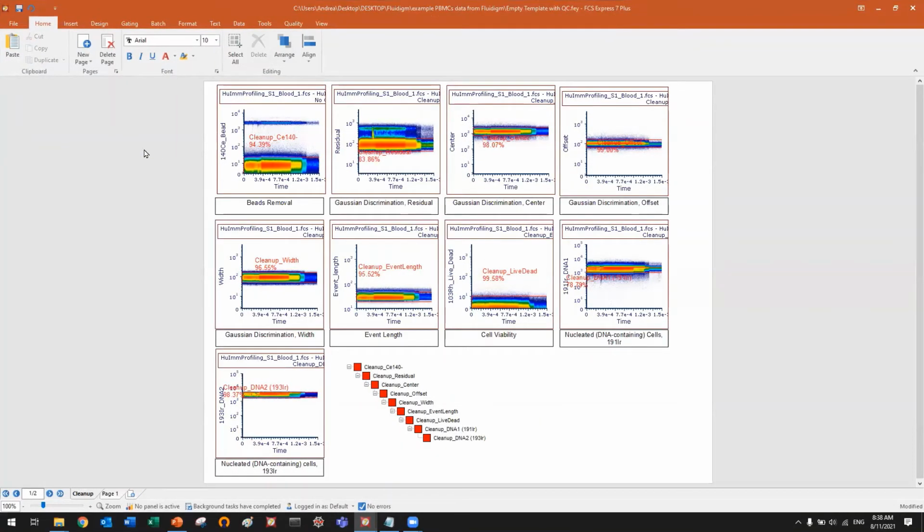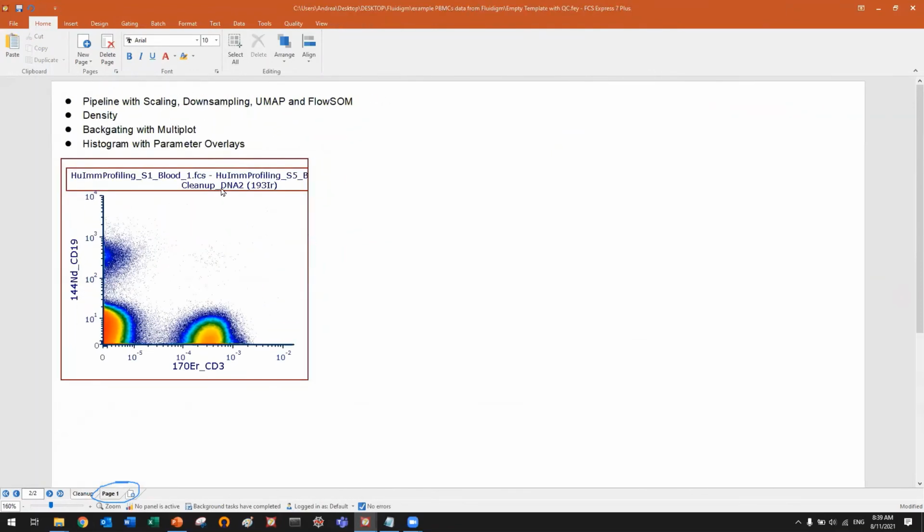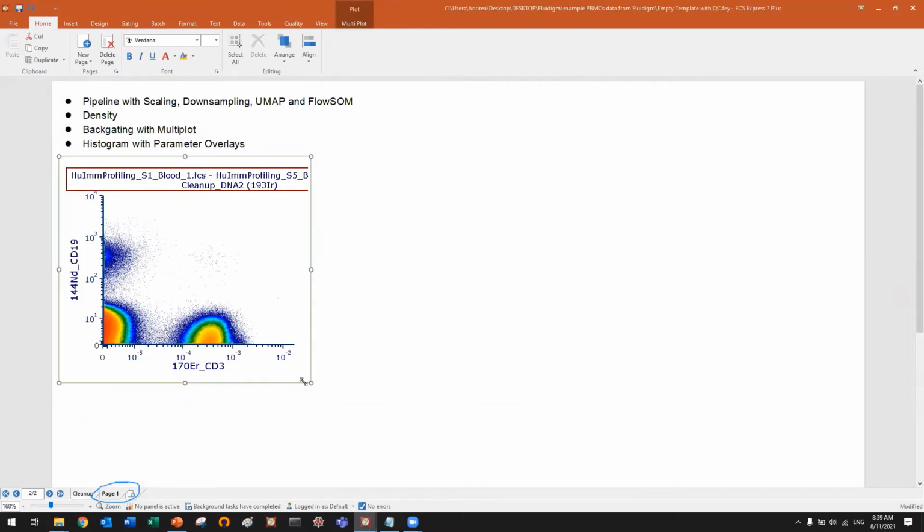Remember, it's a layout in which I already have my cleanup gates and cleanup plots. And as you can see here at the bottom, I already created a new page. I call it page 1. In this page, I just have one single plot. It's already gated on the cleanup DNA 2, which is the last gate of my cleanup strategy. So this is fully cleaned.